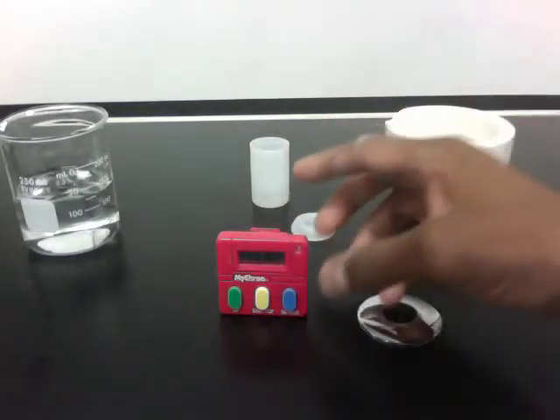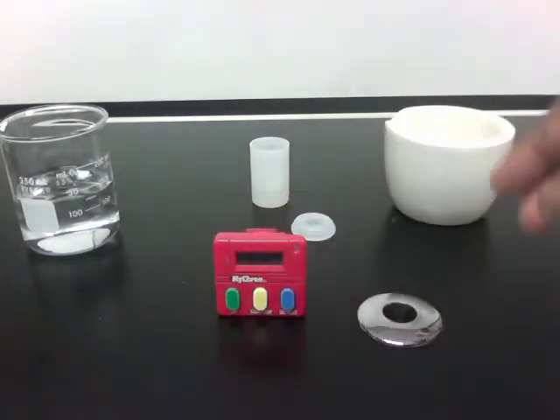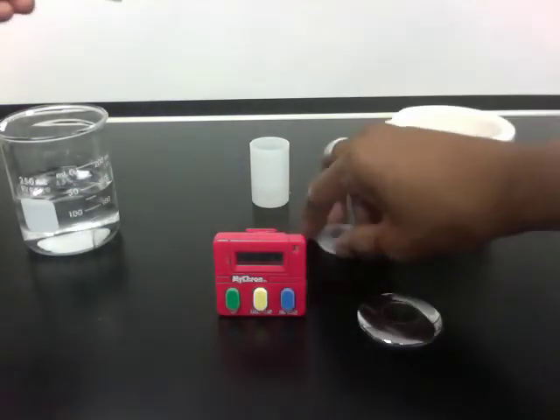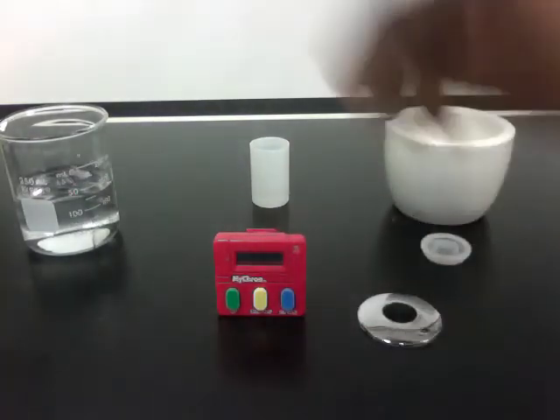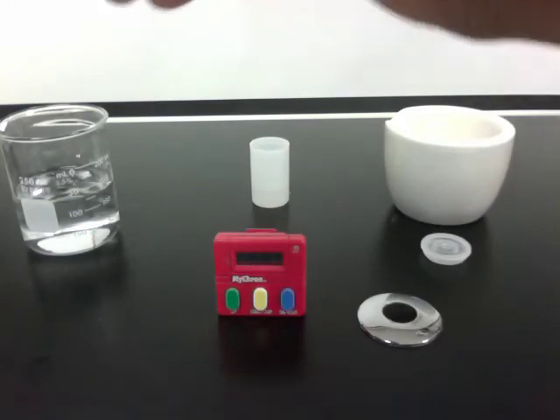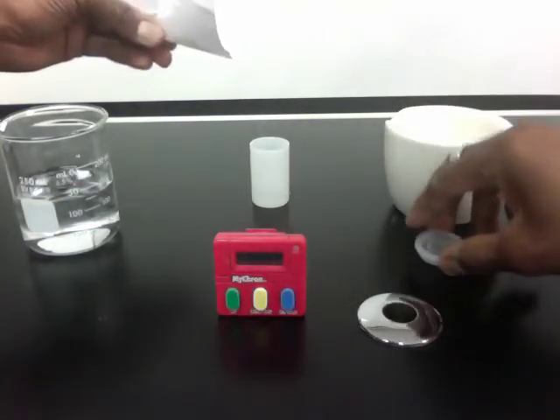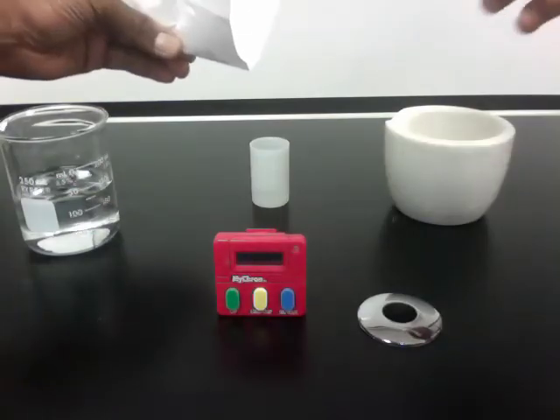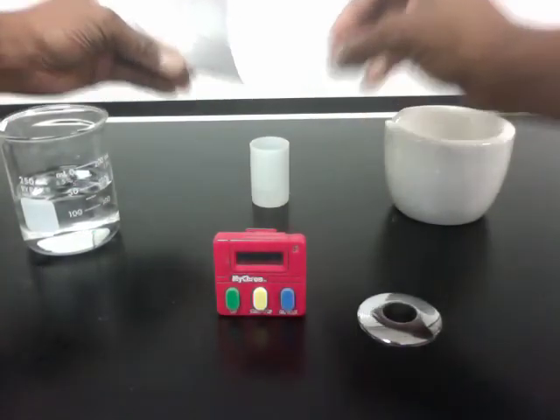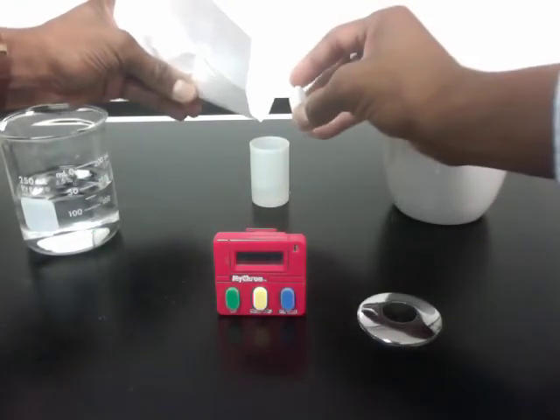We'll reset our timer. Now I'll try to carefully pour this in. The amount should be exactly the same as the whole tablet — the only difference is that it's crushed up. I'll try to pour it in and start timing. A little bit more difficult here, but we'll try it.